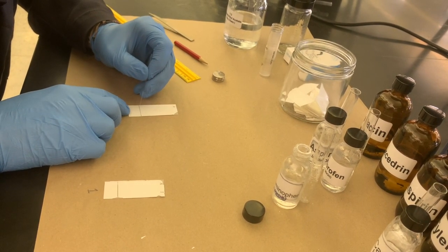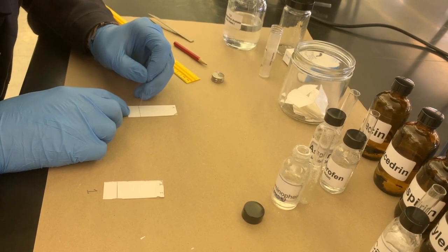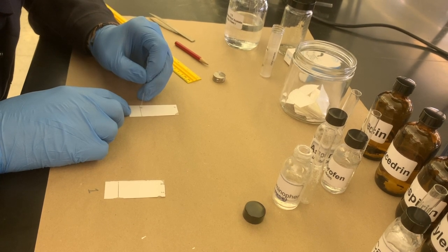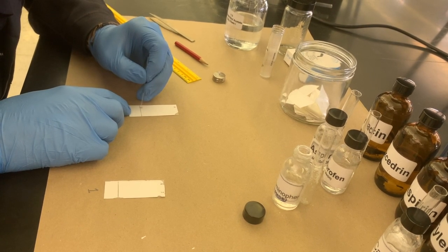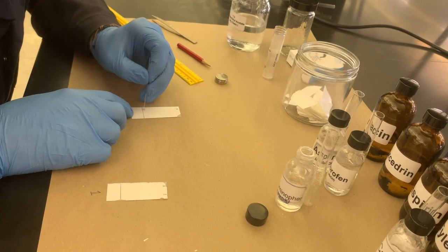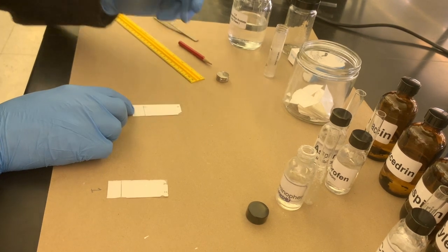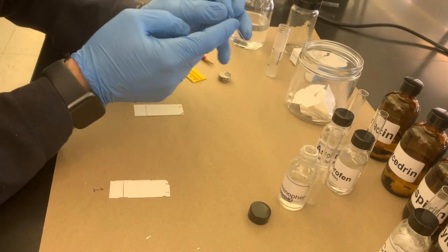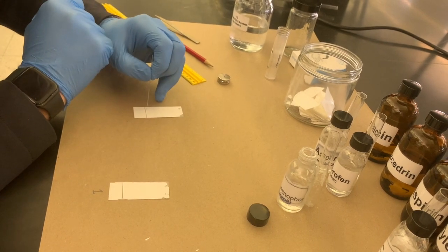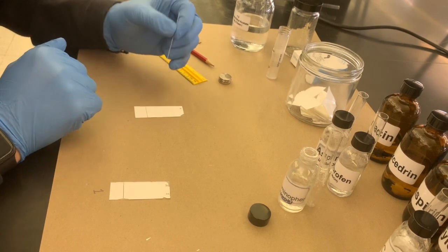Anyways, so you have a small spot for your acetaminophen. Remember to keep it nice and tight here. You don't want it to be wide. You want it to be in just one little spot. We'll make sure we drain all of our sample. The capillary tube will actually pull quite a bit in, so you will have plenty to work with. Don't just jab your sample, otherwise it's going to leak all over your plate.